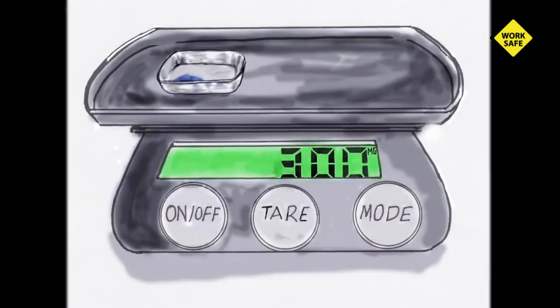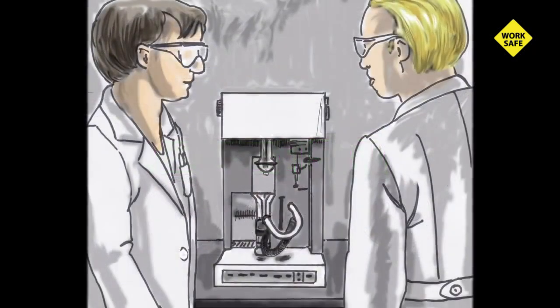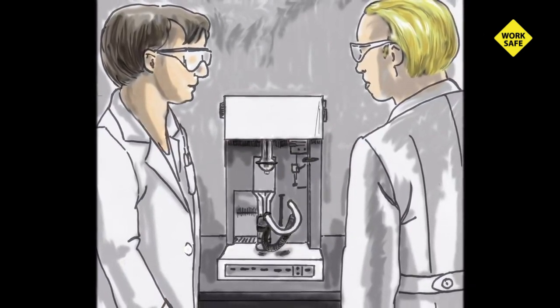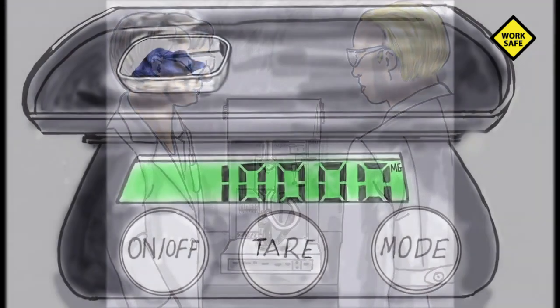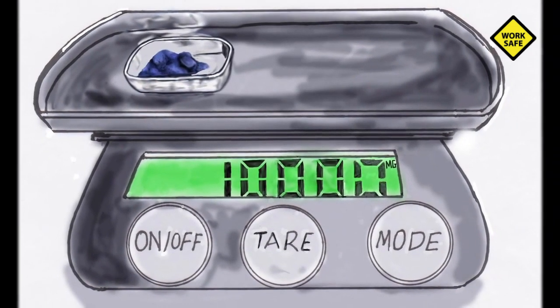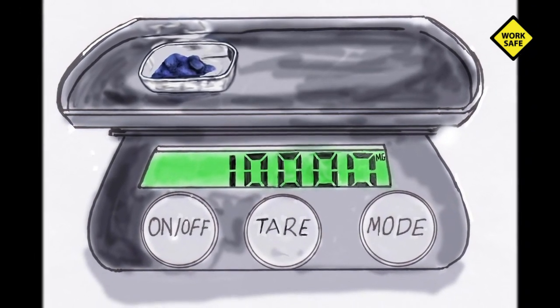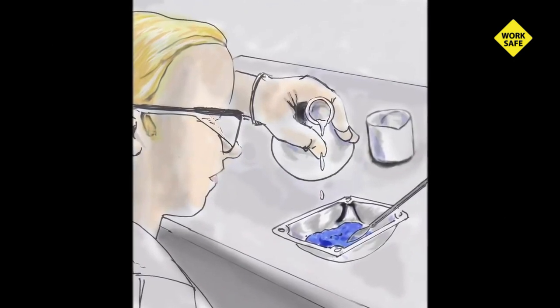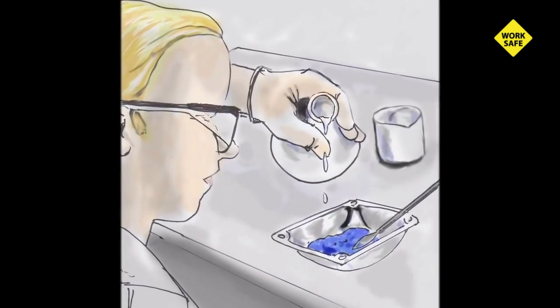Initially, the compound was made in small batches of less than 300 milligrams. But the two students were concerned about potential variability among different small batches of the compound, which could affect later test results. So they decided to scale up the synthesis to make a single batch of approximately 10 grams, enough for all of their testing. They believed that keeping the solid compound wet with the solvent would keep it from exploding.